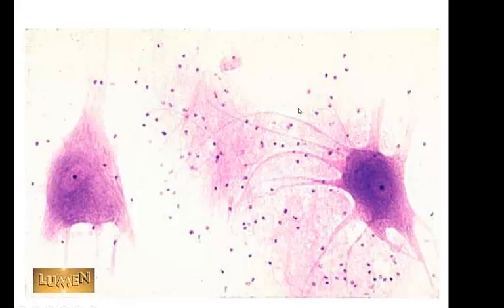Our neurons, you notice, have many extensions that come off of them. These extensions are called dendrites, or it might be an axon. We have one single axon and we have many dendrites that come off of a neuron. You can't tell which is the axon in the cell and which are the dendrites. This is the nucleus, and this is its nucleolus. So it's a lighter staining nucleus here and a dark staining nucleolus. And here's our nucleus to this neuron and its nucleolus. And then again in the background we have all these glial cells, which are the helper cells to these neurons.